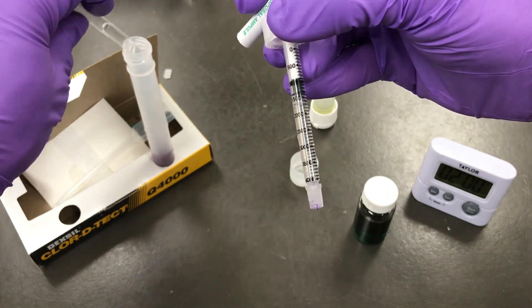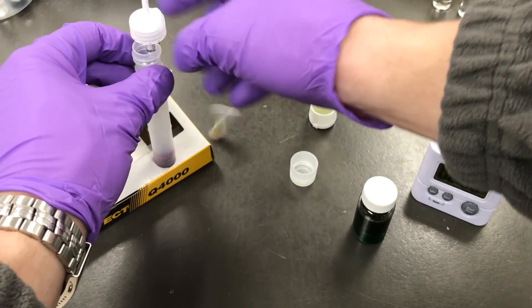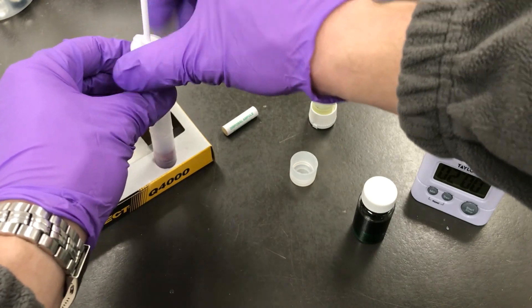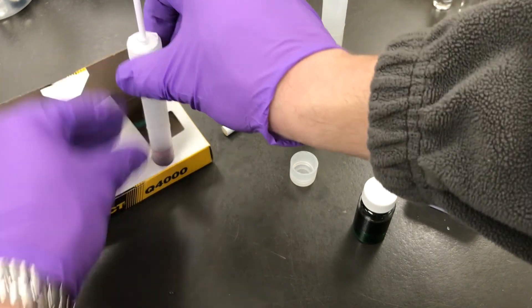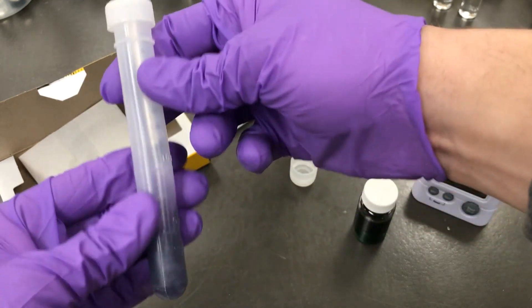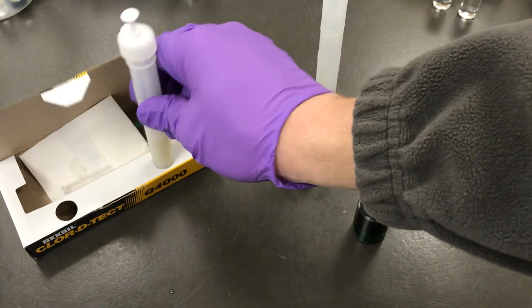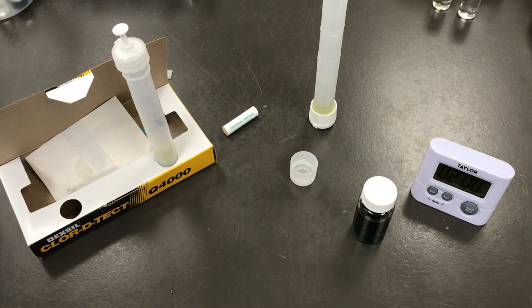Next take the disposal ampule, place it into test tube 2. You can then reinsert the titration burette, screw it on, and dispense any remaining liquid. And then break the disposal ampule to make the mercury insoluble.